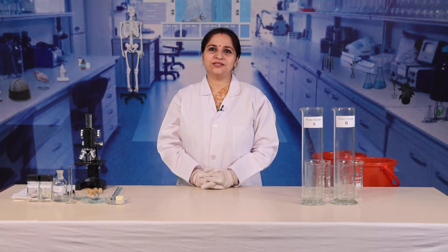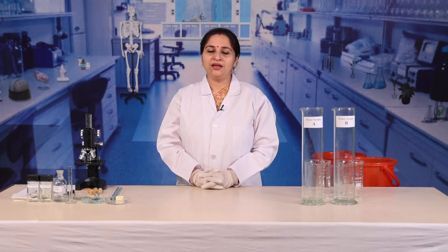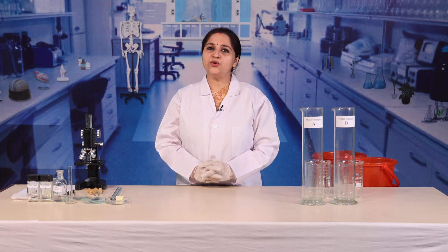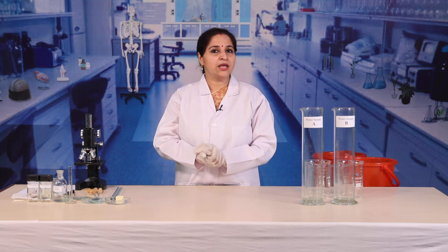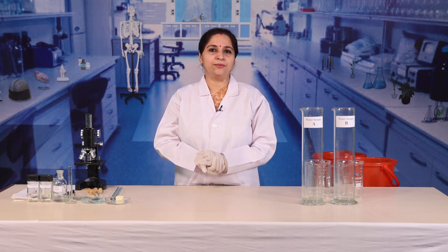Hello, dear learners. Today, in this session, we are going to analyze living organisms in water samples.